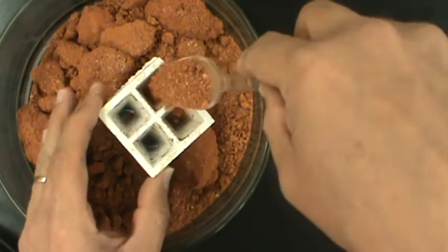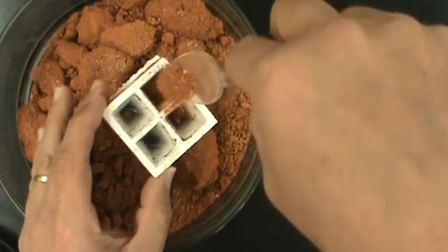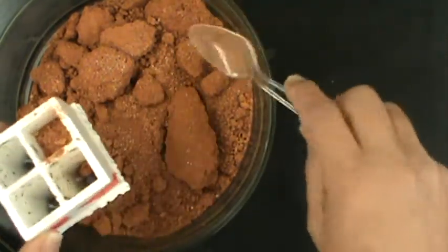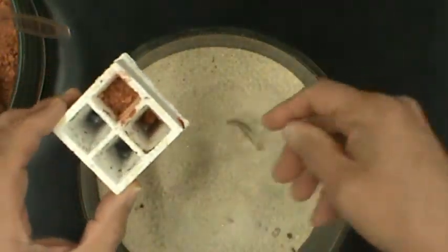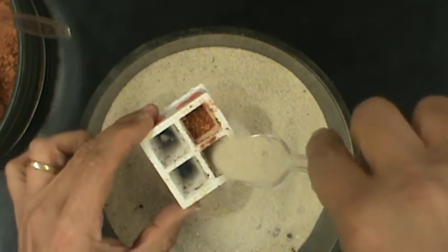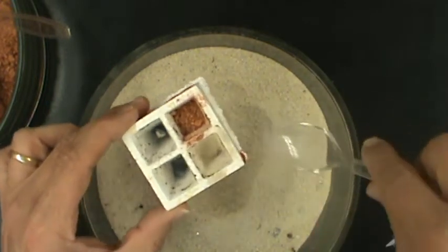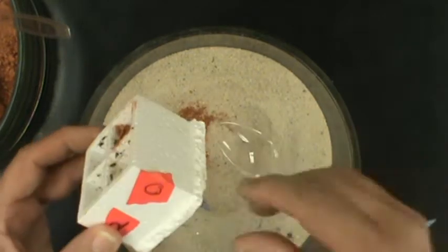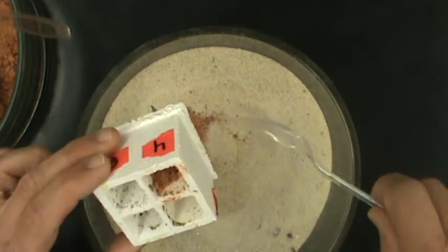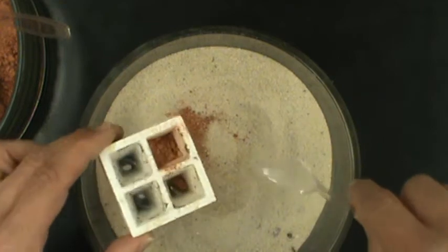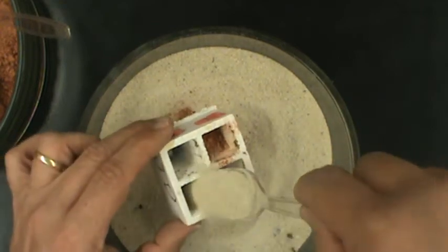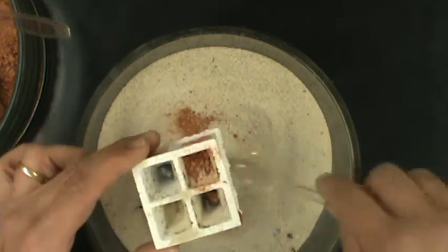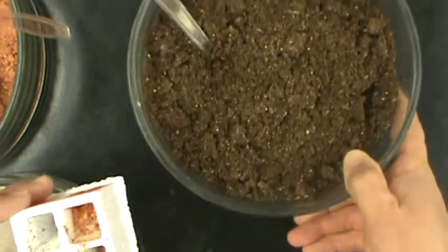We have clay soils, we have sand. Sometimes sand is a little tricky to get to stay in the actual quad. I need to find a quad that has a small hole. We have loam soils.